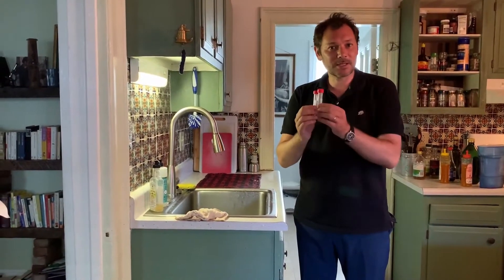In your kit you have two centrifuge tubes like that, and that's what we're going to use to sample the drinking water. In theory we should use larger volumes, but we'll assume that this works and in fact it's going to give us some results.